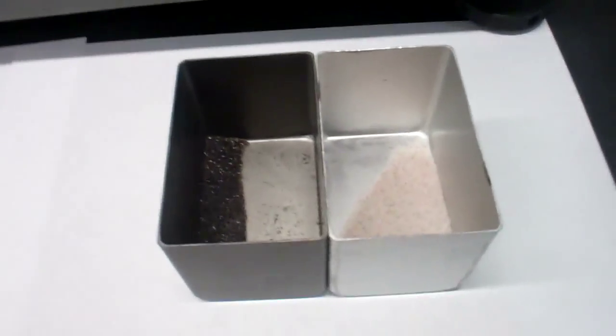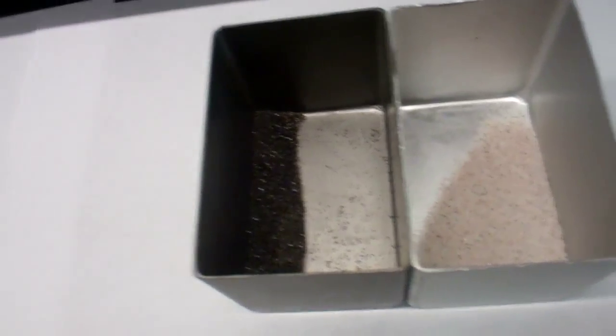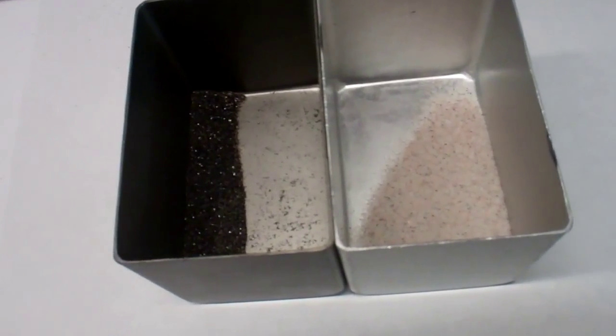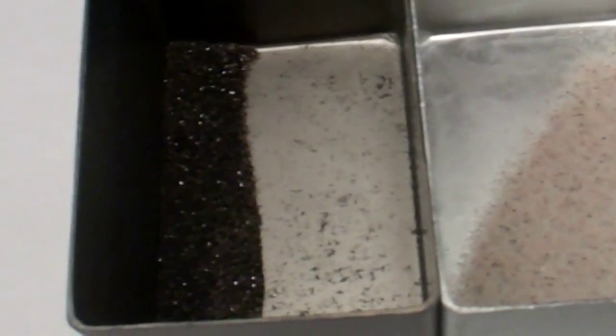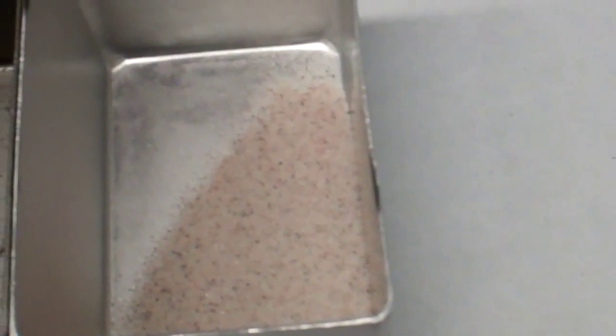So the two separations of magnetic and non-magnetic are really different in color. Check it out. Magnetic is the dark stuff. Non-magnetic is the light stuff. This is what we are going to look at. This is what we're going to bottle and put away later. But it's such a difference.